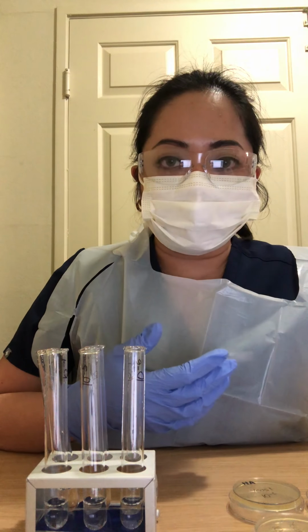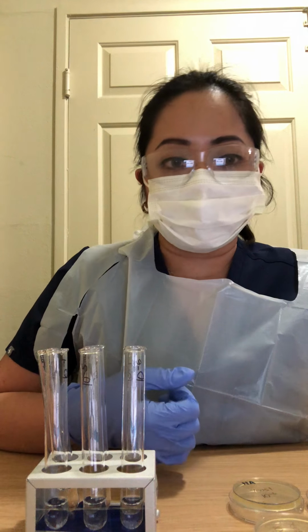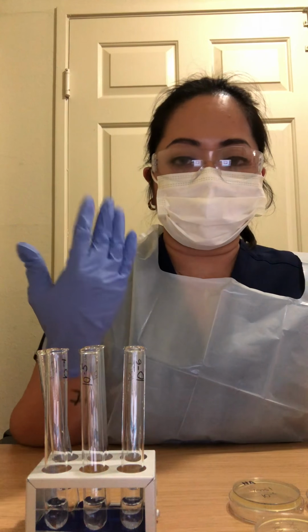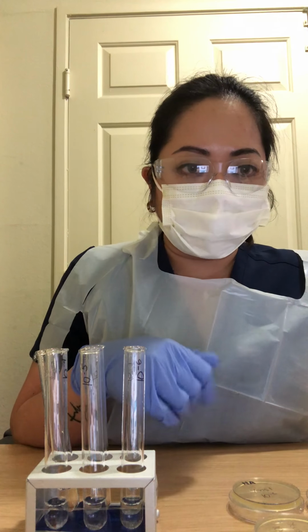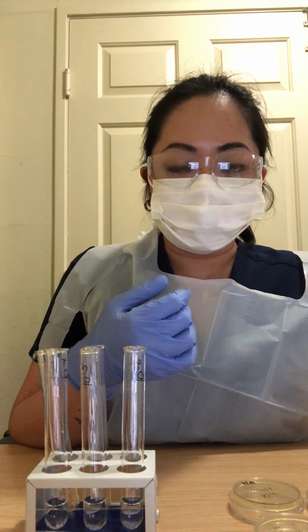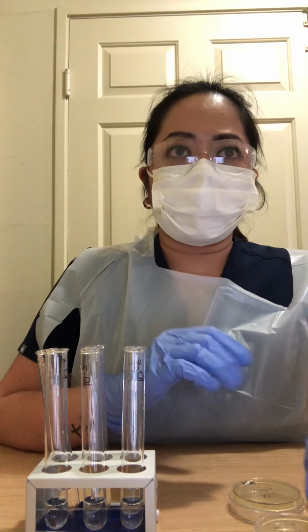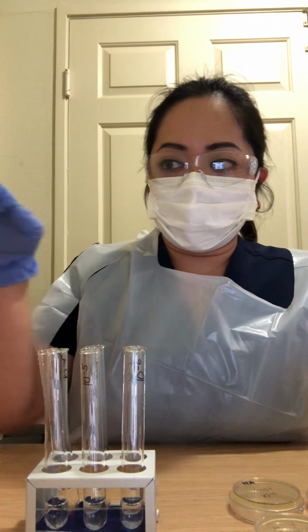And for this video exercise, I will be doing the bacterial enumeration, dilutions, and plate counts. So I've already washed my hands and put on my protective equipment such as my goggles, my mask, my gloves, and my apron. I also cleaned my work surface by wiping the area with 10% bleach solution, and I also gathered all my equipment.